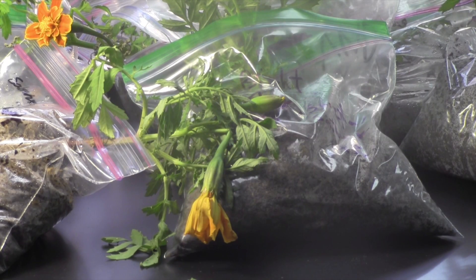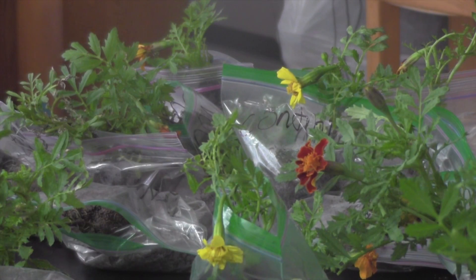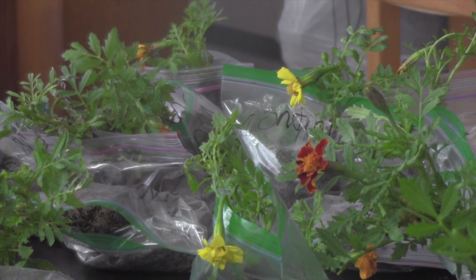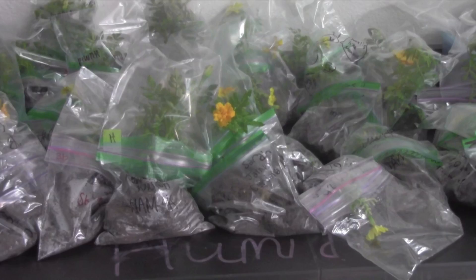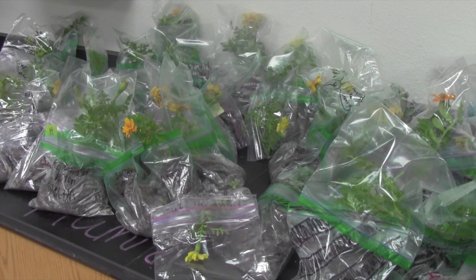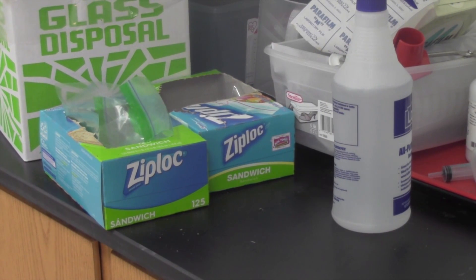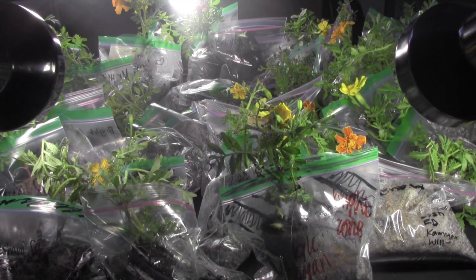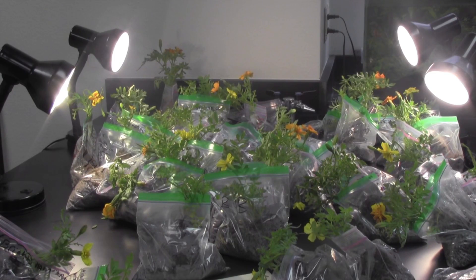Each plant is placed in a certain environment to mimic various environmental conditions. One plant will be placed in the control environment, which receives normal light and air. Another plant will be placed in the windy environment, which is on a lab table by a fan. The third plant will be placed in a humid environment — students will mist leaves with water and cover the top of the plant with a second plastic bag to prevent the mist from leaving. The final plant will be placed in a sunny environment, which is a lab table with four lamps positioned to direct light on the plants.